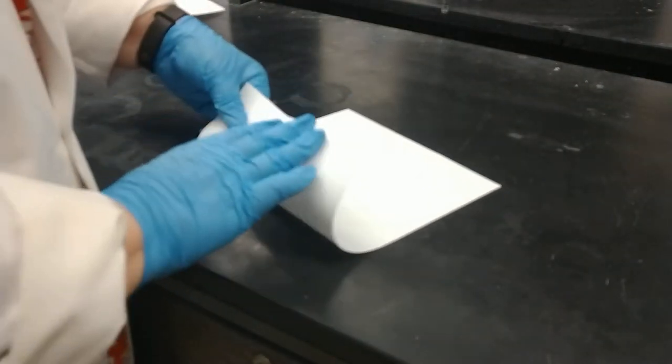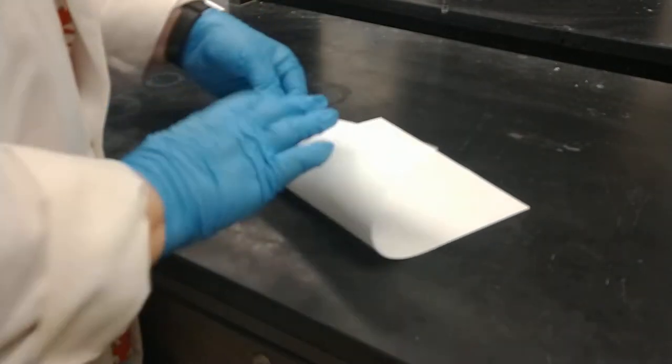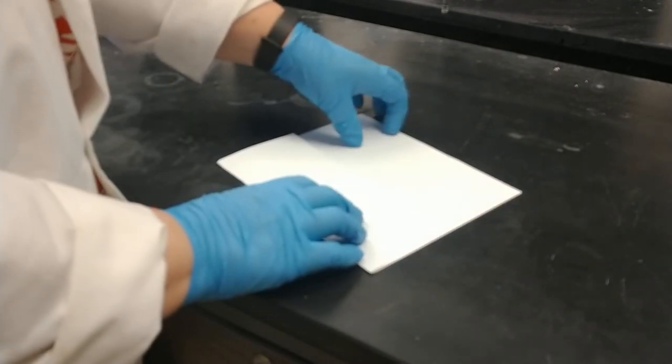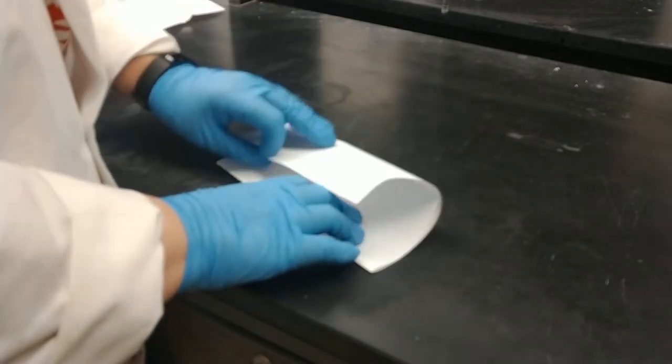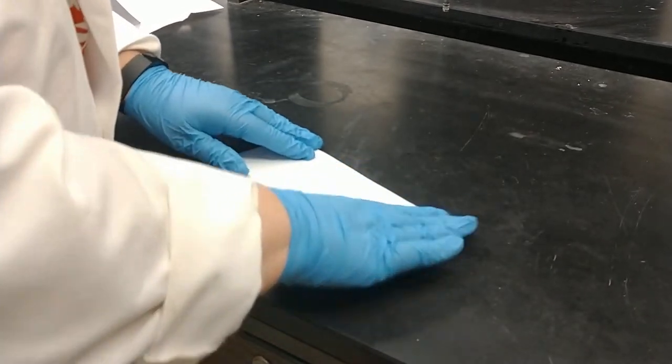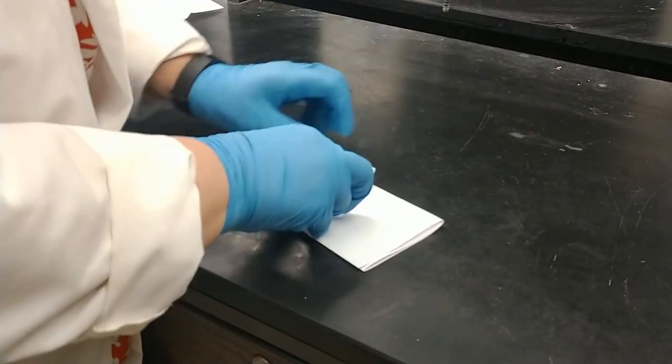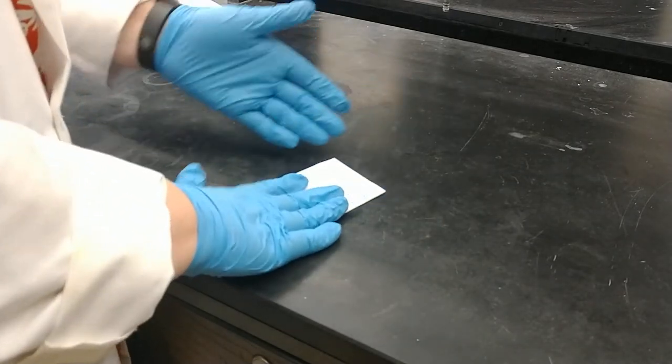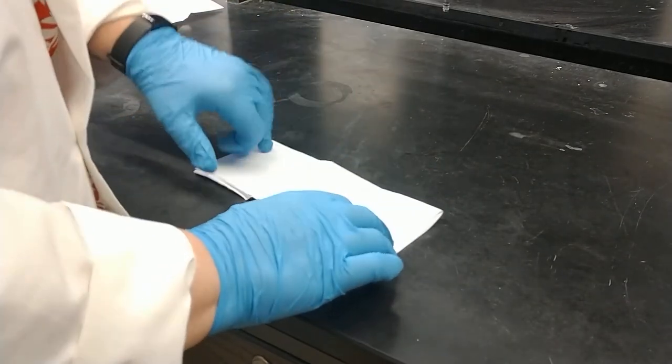In a druggist fold, the typical druggist fold is folded in thirds from one direction and then the other direction. Then it's folded in thirds from the side and the side. You could do the sides first and the top first, you can do it in any order.